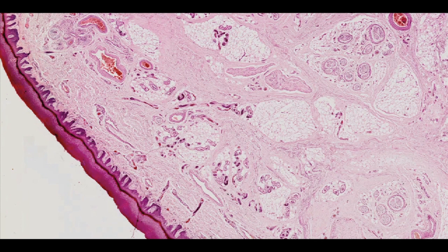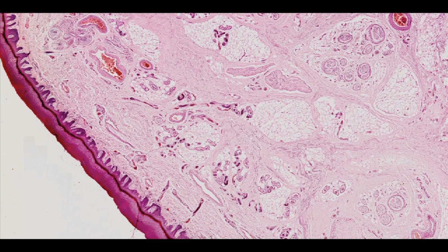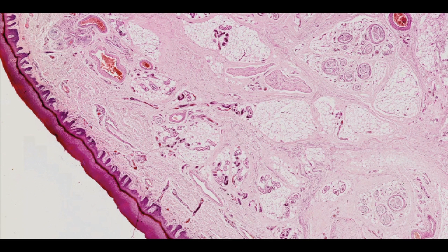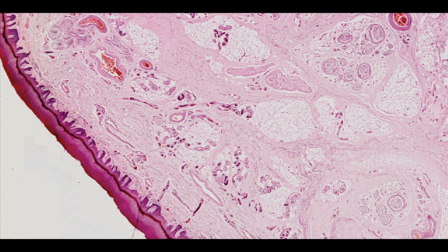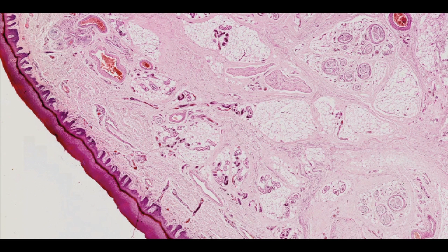Non-hairy, glabrous skin, H&E staining. The specimen shows a longitudinal section through glabrous skin, stained with routine H&E method.